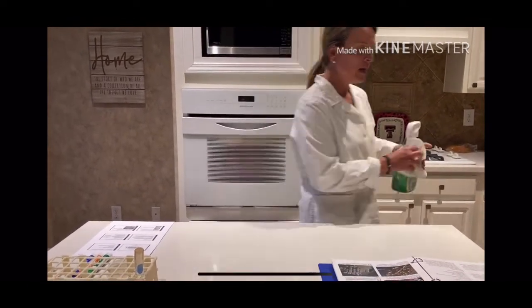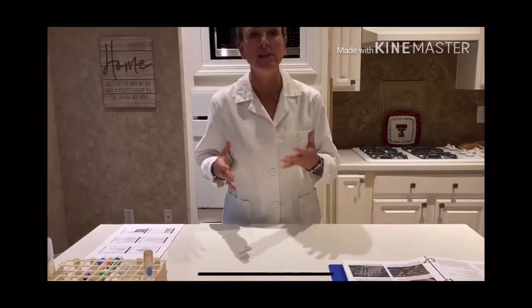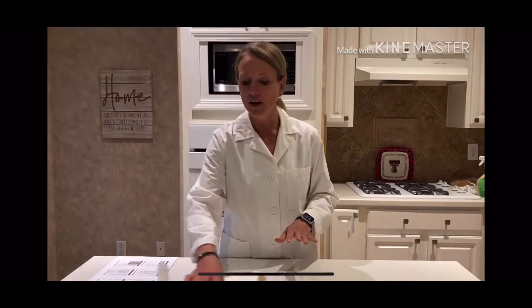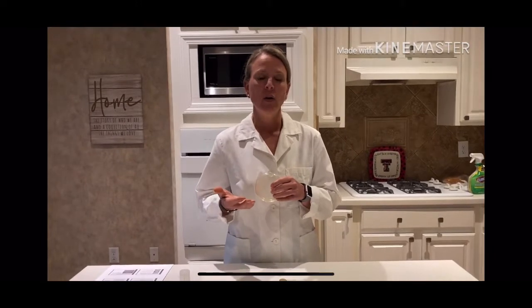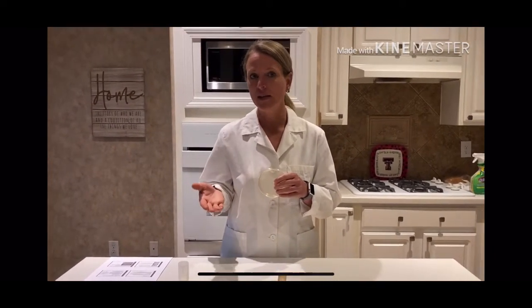Okay, so now that I have my lab bench cleaned and I've got my specimens out, we're going to go through and describe what we'd see on the plate. If you were doing this in the actual lab setting, you would take your broth and your slant and your plate from the organisms that you grew up before in the aseptic transfer lab. Then really what you're doing is looking at the colonies and trying to describe what the colonies actually look like growing on the plate, the broth and the slant.